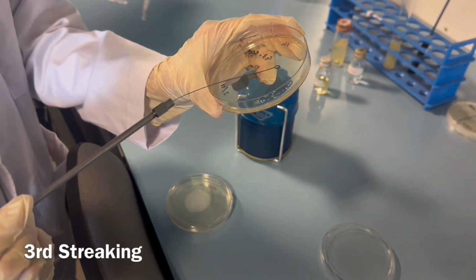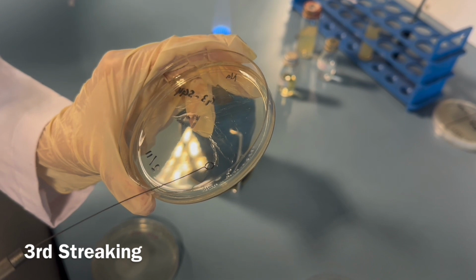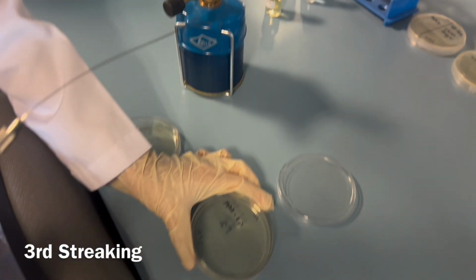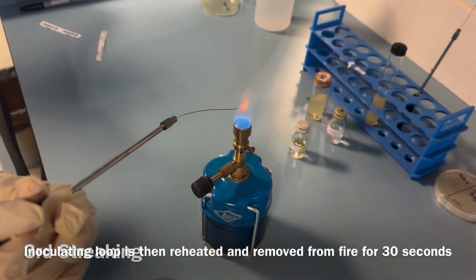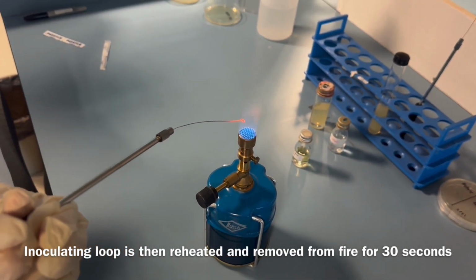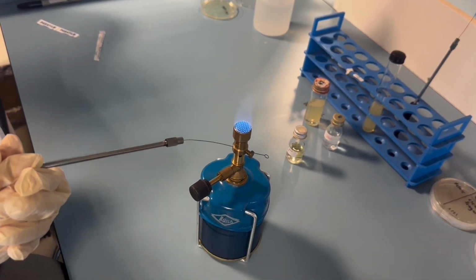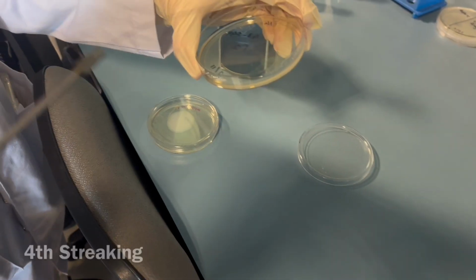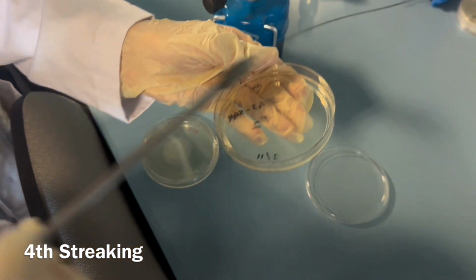So here is the third streaking. And then the inoculating loop is reheated again and removed from fire for 30 seconds. Here is the fourth streaking, the final streak, final quadrant.